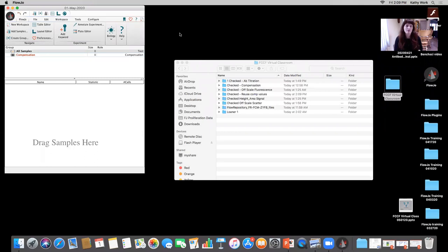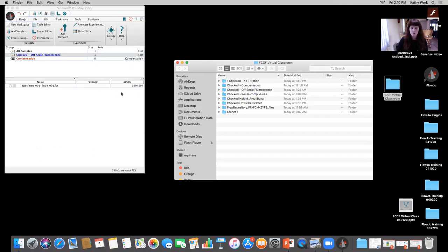Another example I have is, we've talked a lot about scatter scaling and everything like that. I have an example also of off-scale fluorescence. So what wound up happening is, you run the controls, everything looks good, right? The single colors are all great. And then once you take a look at the actual experiment itself and the experimental sample itself, there can be changes there, right?